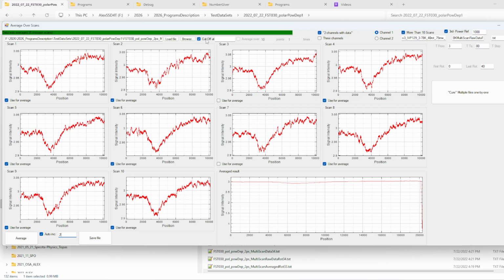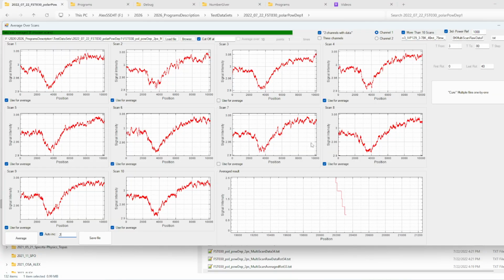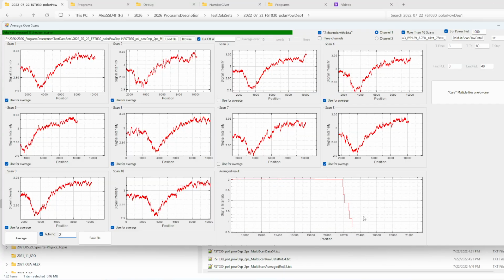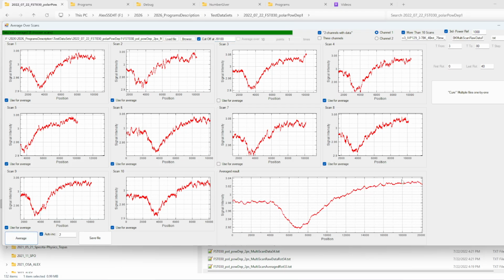Lastly, there is a function, cut off at. Sometimes for some files, you can see that here I have some zeros. I don't know where they come from, but from one of the files I see this effect. This is non-physical. These steps are due to the fact that some of the files end before other files, and the program sets 0 for that file, so it averages not all 10 files, but let's say 9, 8, 7, 6, and fewer and fewer. So here I need to cut off at, let's say, 20,100, to remove all of those bad points, and then if I click average, the rest is removed.